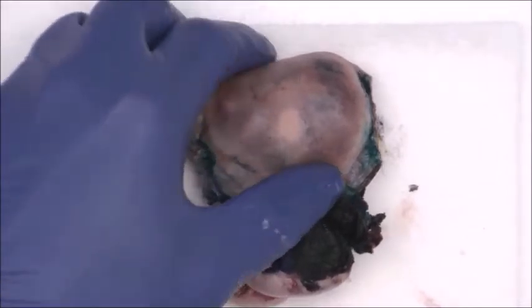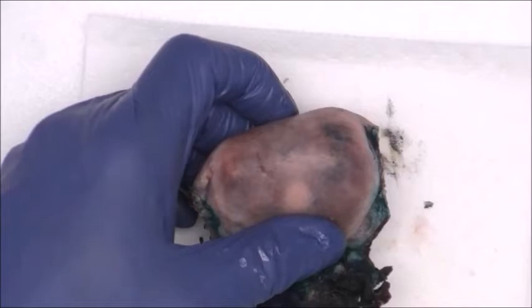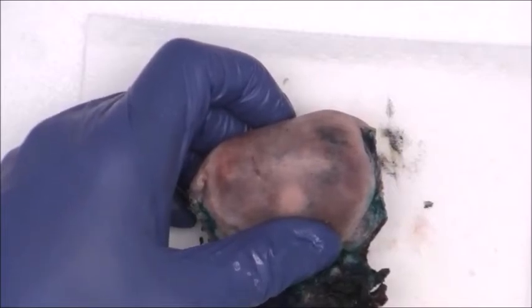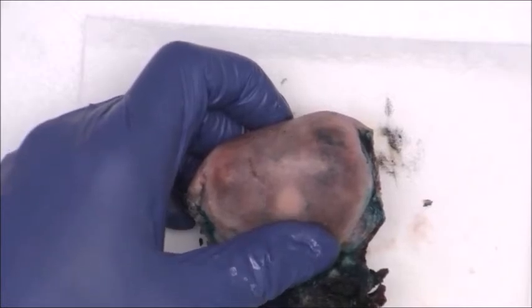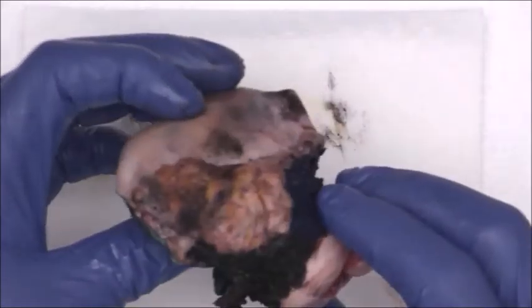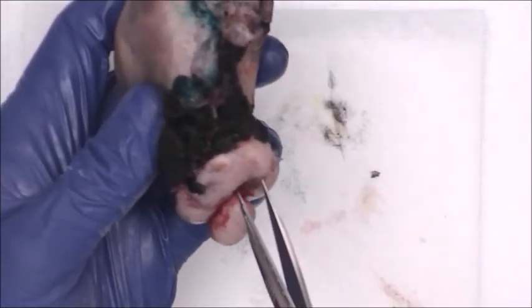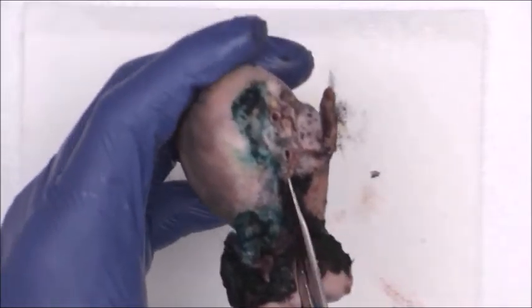Okay? Now you can always ink one adnexal structure one color and then the other side another color. I just usually designate what's what in the cassettes, and that works out okay. Now what we're going to do is open up this uterus. There's a variety of different ways of doing it. The way we do it is we use scissors, and I kind of like this method as opposed to putting a probe in, as long as the scissor blades are nice and sharp.